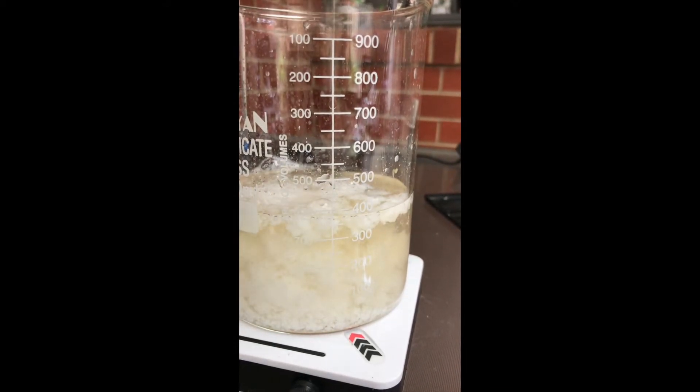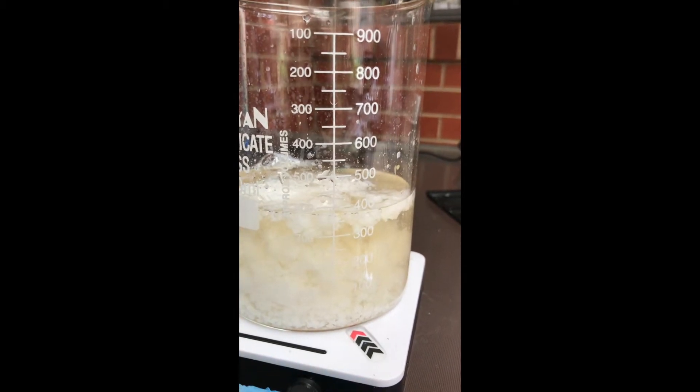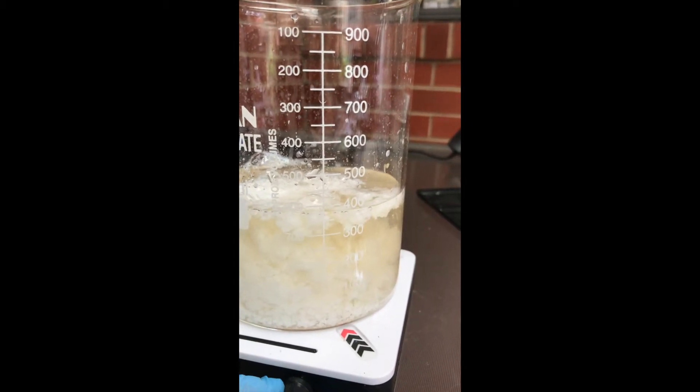This is a double displacement reaction. This type of reaction in which two reactants change ions to form two new compounds.